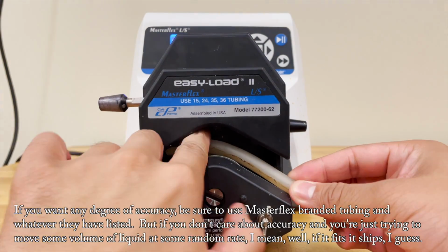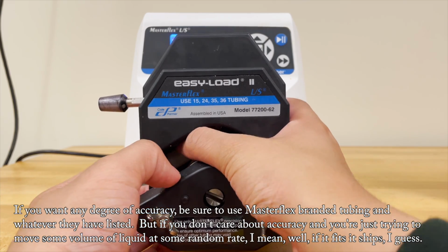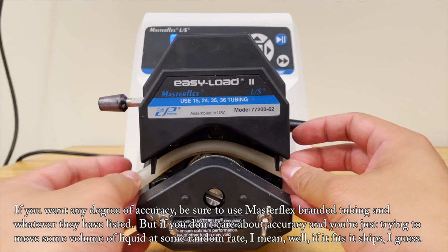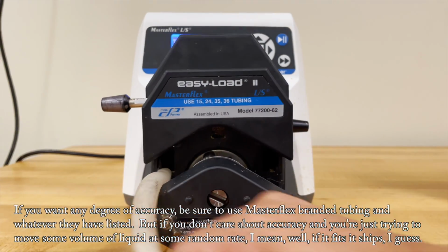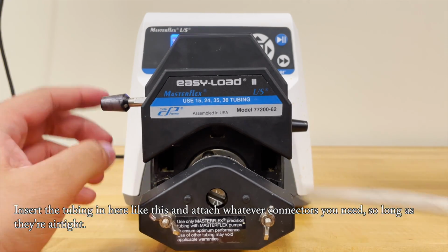If you want any degree of accuracy, be sure to use Masterflex branded tubing and whatever they have listed. But if you don't care about accuracy and you're just trying to move some volume of liquid at some random rate, well, if it fits, it ships, I guess. Insert the tubing in here like this and attach whatever connectors you need so long as they're airtight.